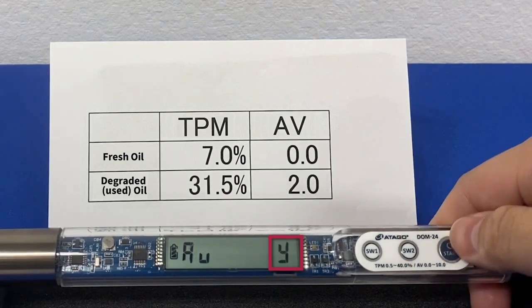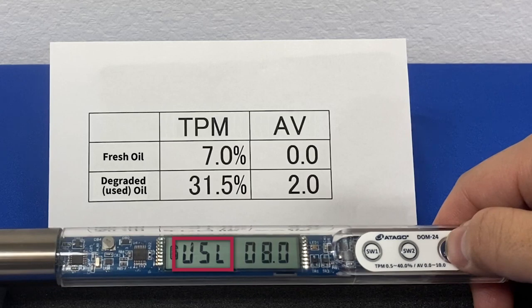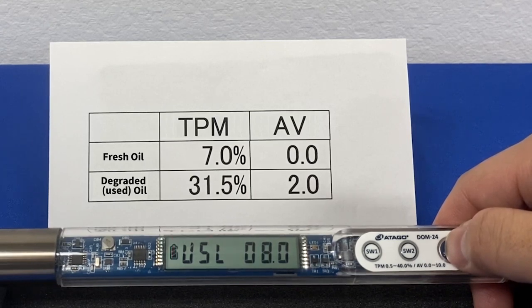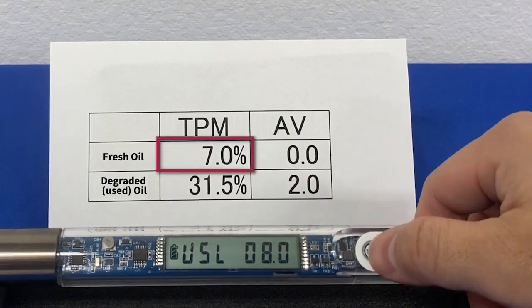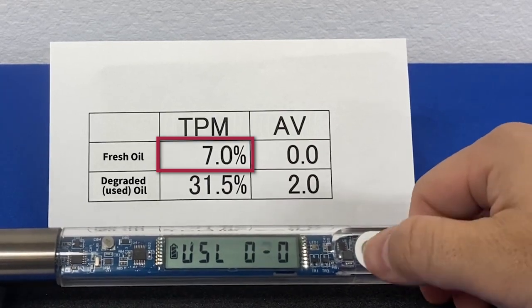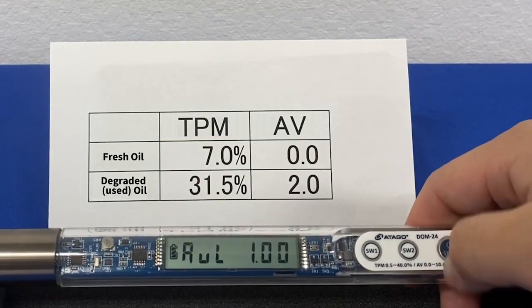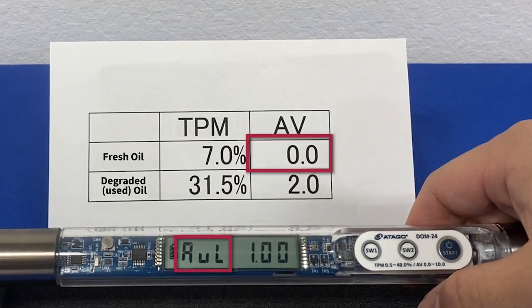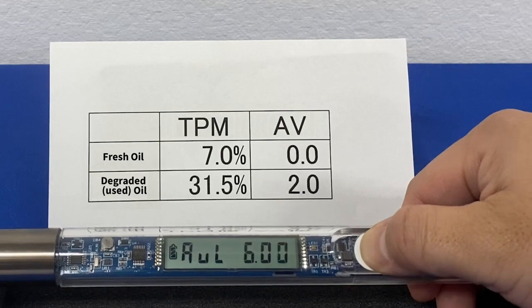Press SW2 to change the display to AVY. Next, press start to move the display to USL, which means user scale low. Here, enter in 7% TPM, which was the value of the fresh oil from earlier. Once entered, press start to move to the next setting. Next is AVL — enter in 0.0 for the acid value of the fresh oil that was measured earlier, and press start.